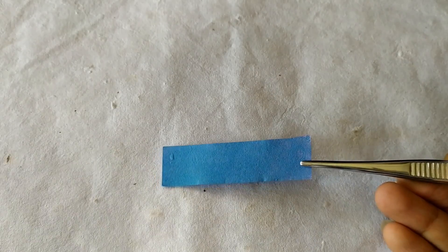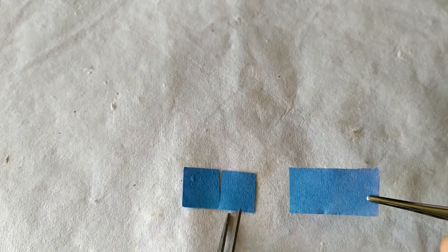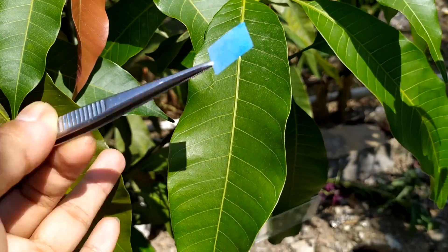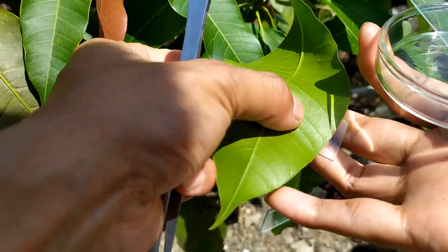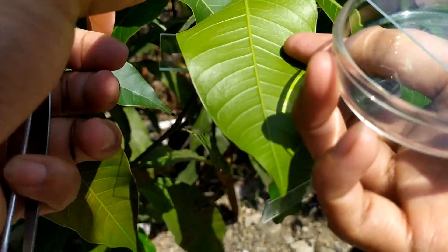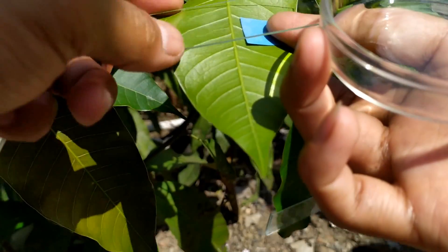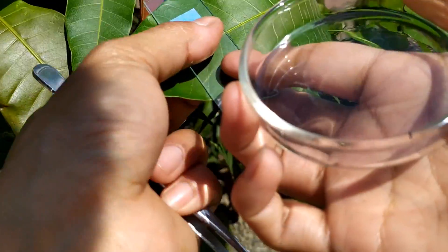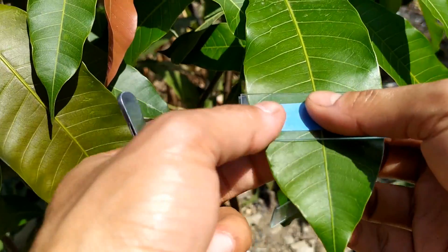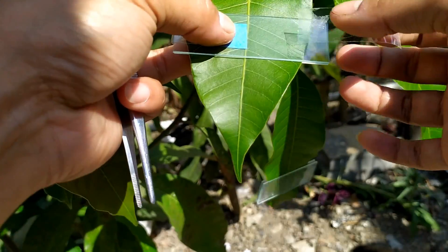Remove a strip of cobalt chloride paper from the bottle using a tweezer and cut tiny identical squares from these strips using a pair of scissors. Using a tweezer, place one paper square on the upper surface of the leaf and place a glass slide on top. Holding the slide in position, turn the leaf upside down and place a second paper square on the lower surface of the leaf. Place a second slide on top of the paper square and press both slides together without crushing the leaf.